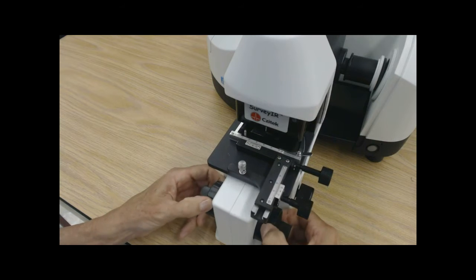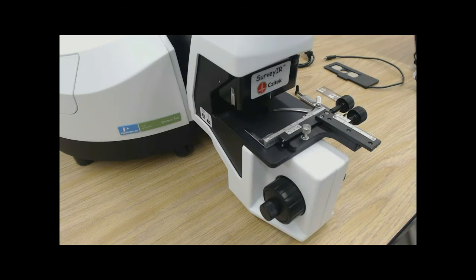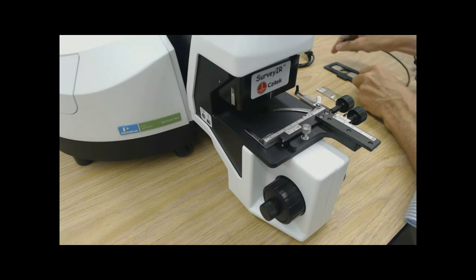We also have 1 by 3 inch format transmission window holder. Greg will now show us the installation of the contact alert force readout.